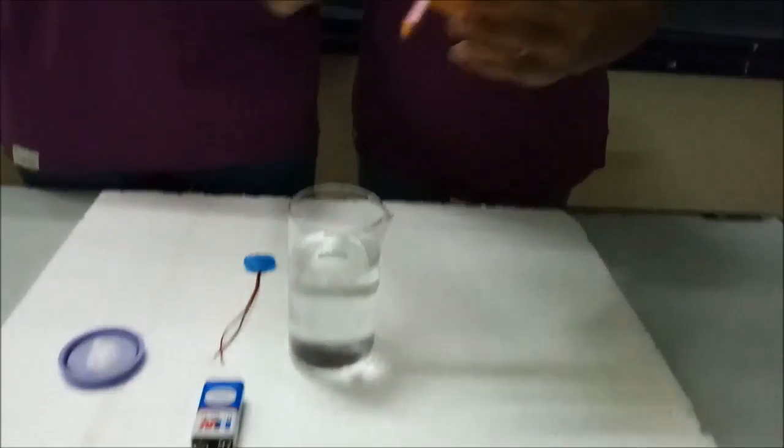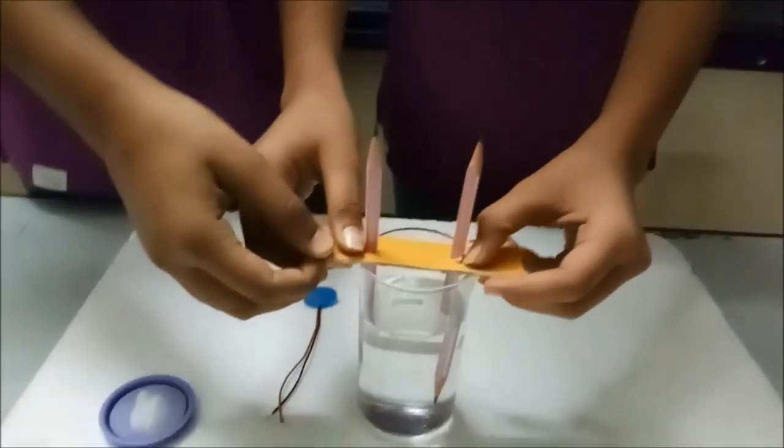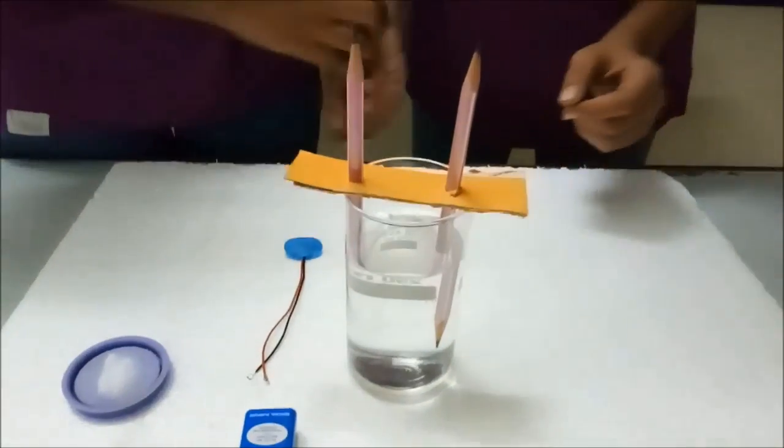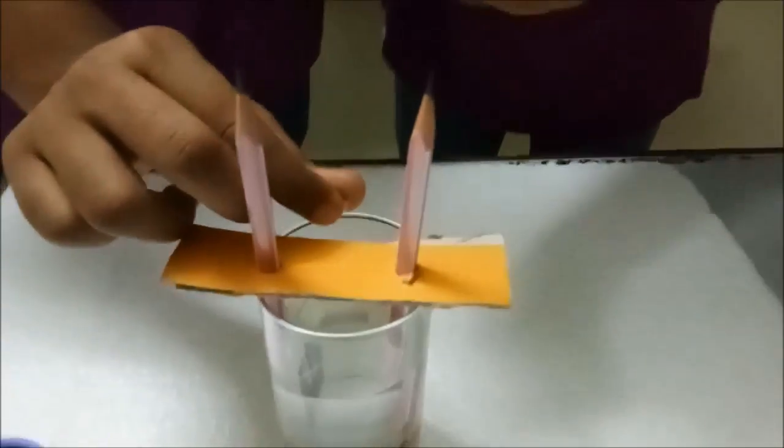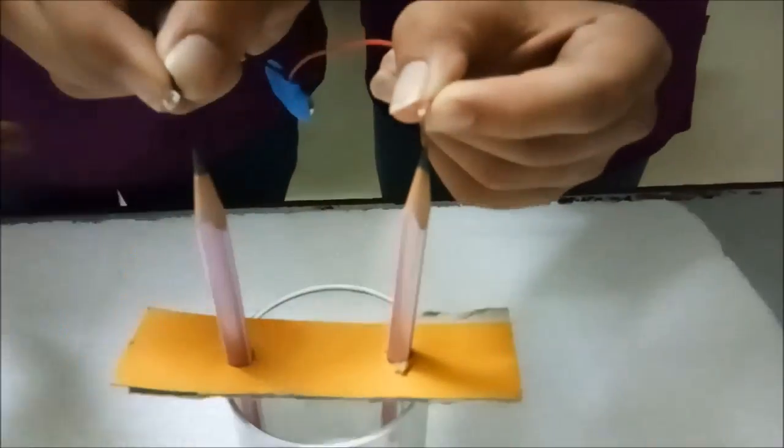First we will put both the pencils into the beaker and then we will connect both the connecting wires with the pencils.